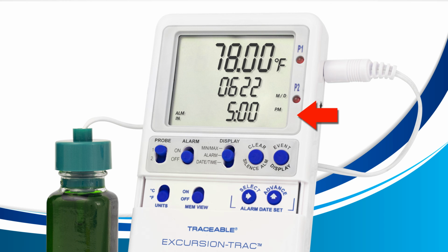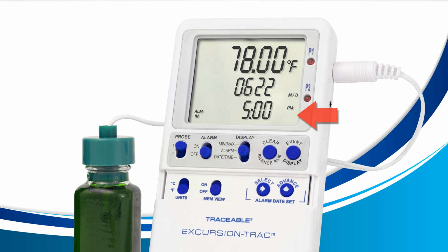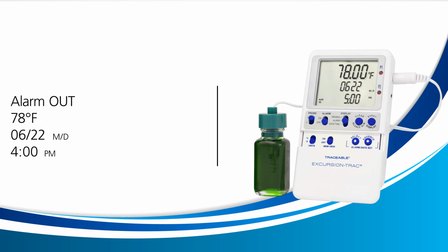In summary, if we put the alarm out and alarm in information together, we can see that the environment we were monitoring was at a temperature range higher than 78 degrees Fahrenheit for 1 hour between 4 p.m. and 5 p.m. on June 22nd.